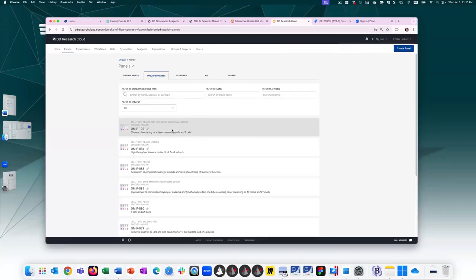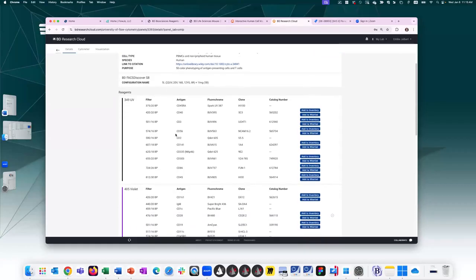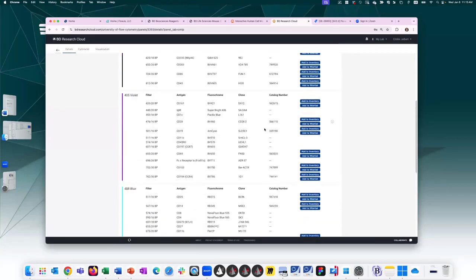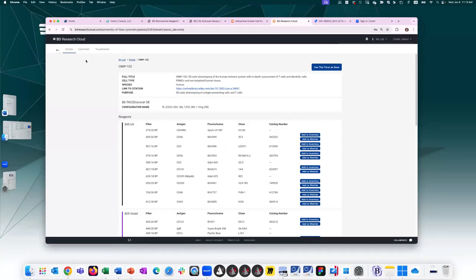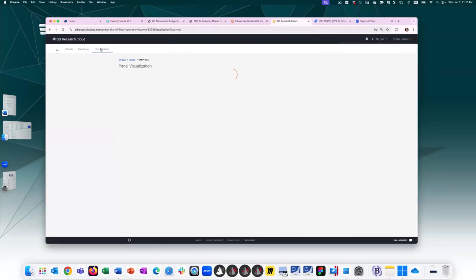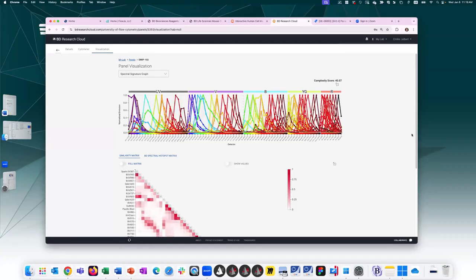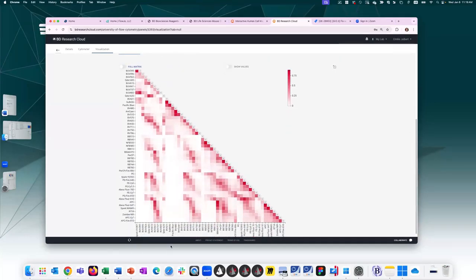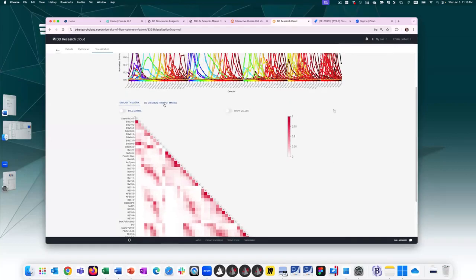For example, if I click on this 50 color OMIP 102, I will see the details of this panel. Right, so which antigen was used, which fluorochrome, which clone, the catalog number. There's a link to the citation. If I tab over to the next tab, it shows which cytometer the panel was developed for. And the visualization tab will show the spectral signatures of the fluorochromes used in that panel. You can change the view to either the spectral signature graph view or the conventional view. And if I scroll down here, I have access to the similarity matrix of the fluorochromes used for this panel, or the BD hotspot matrix. This one highlights the areas where there might be unmixing dependent spread.